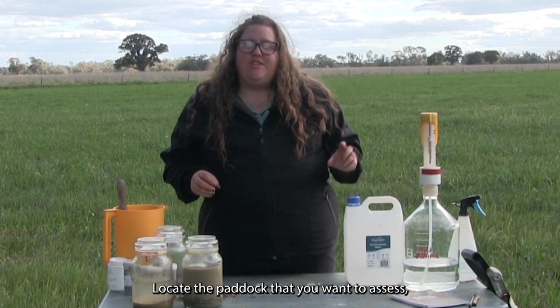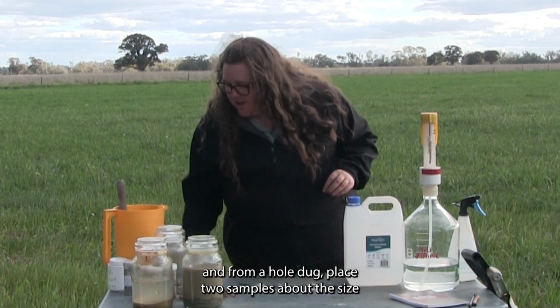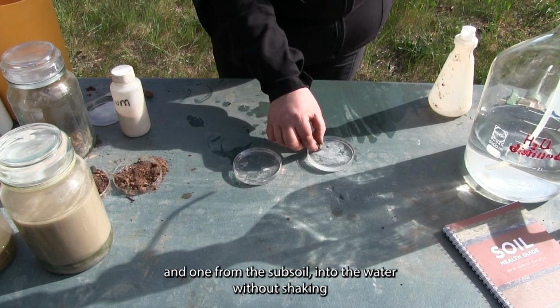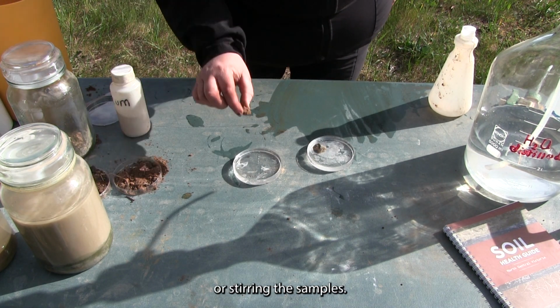Locate the paddock that you want to assess, and from a hole dug, place 2 samples about the size of a small marble, one from the topsoil and one from the subsoil, into the water without shaking or stirring the samples.